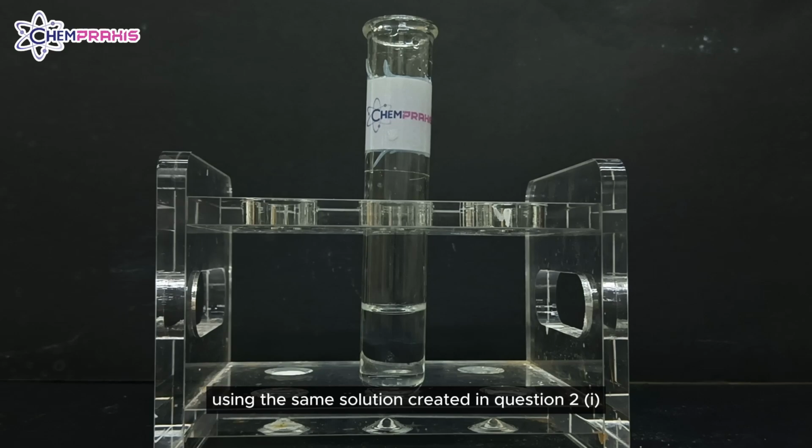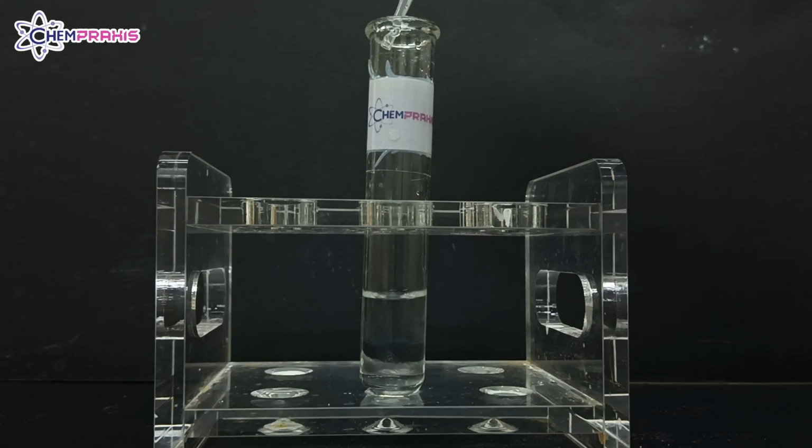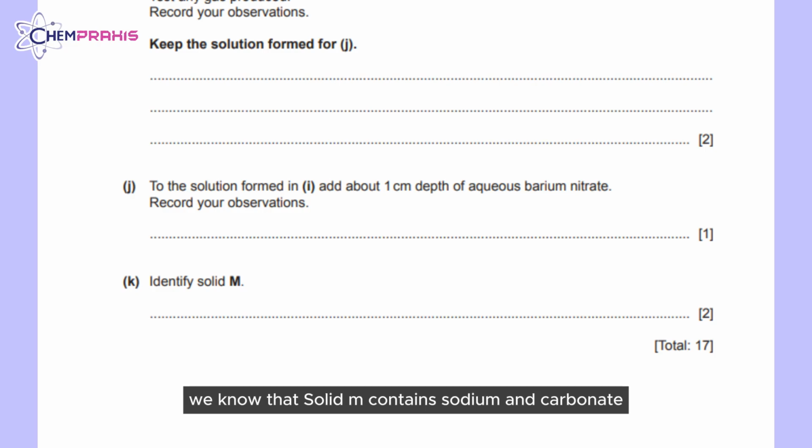Using the same solution created in question 2i, add about a 1 cm depth of aqueous barium nitrate. We can see that there is no change in the solution. Throughout our experiment, we know that solid M contains sodium and carbonate.